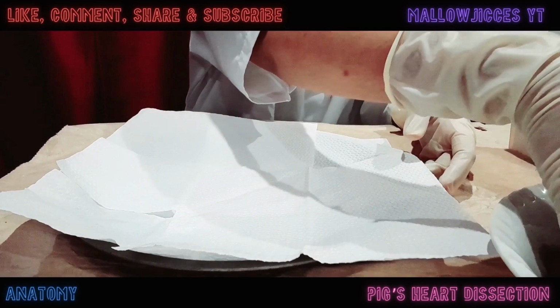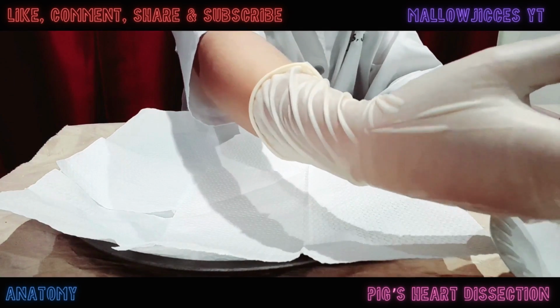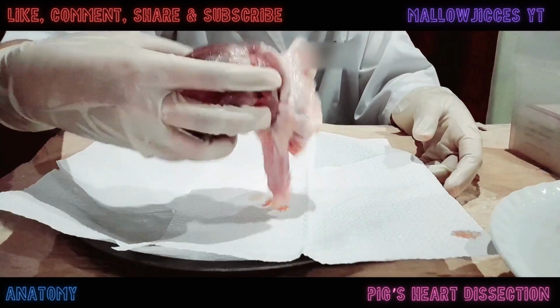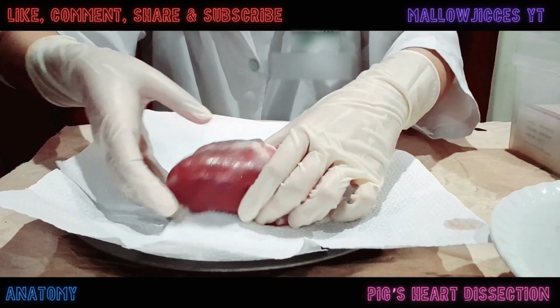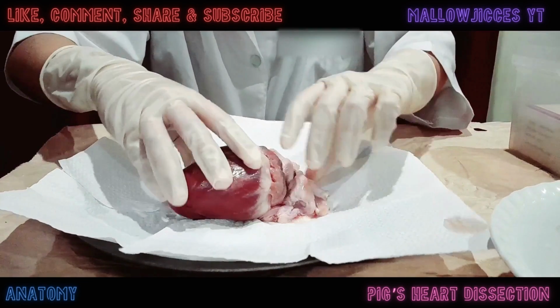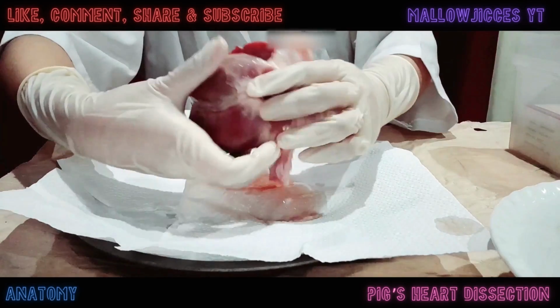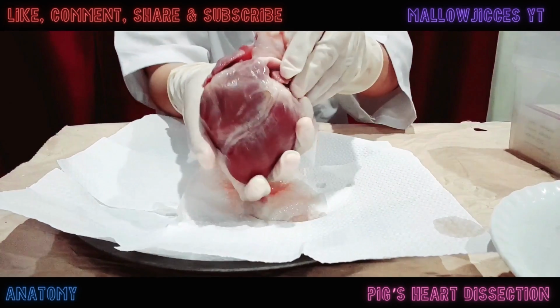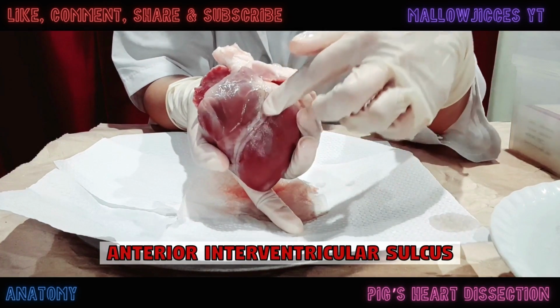First off, I made sure I am wearing a lab gown and a pair of surgical gloves before doing anything with the pig's heart. Now, I'm going to begin with placing the pig's heart on this pan with paper towels. Based on my observation from the anterior view of the heart, there is the anterior interventricular sulcus.